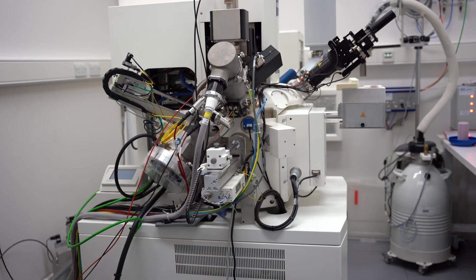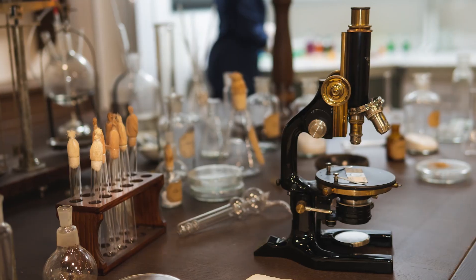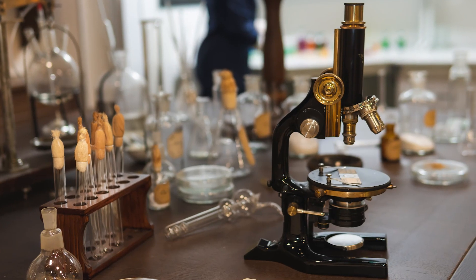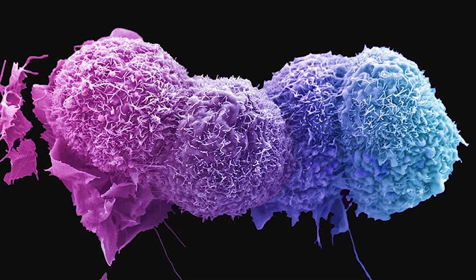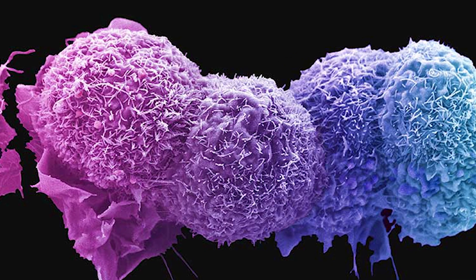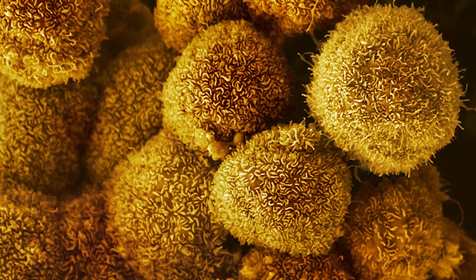Electron microscopy, instead of using light to look at samples, takes it to the next step and uses electrons. The light microscope has been around for a few hundred years, and it was not until the 1930s that they realised you could get higher resolution by using electrons rather than light. It was commercially viable within the 1940s and has been used ever since.